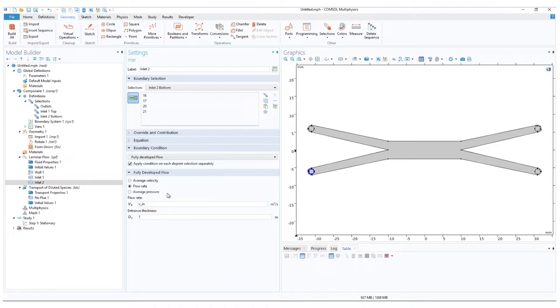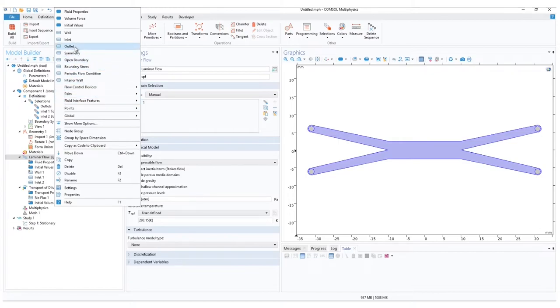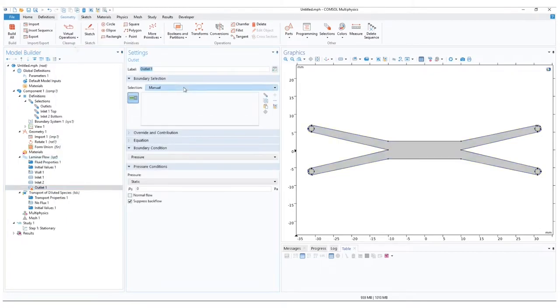Next, we define the outlets. Right click on laminar flow and select outlet. And since our outlets will be the same, it is okay to pick them both. And because we don't want to impose any flow rate or velocity expectations on the outlets, we leave the boundary conditions to pressure and the pressure value to zero. And with this, our laminar flow is set.